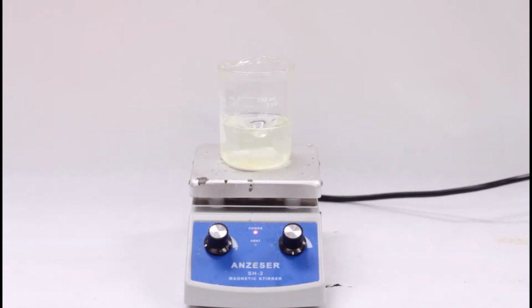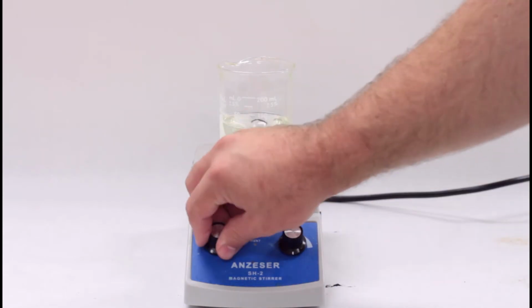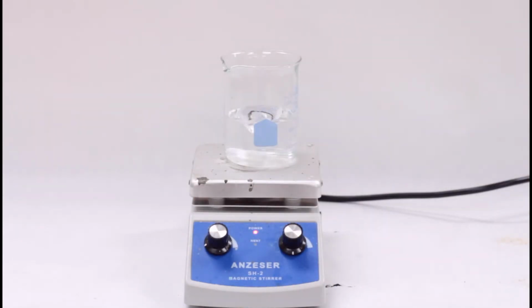The main method you'll use to differentiate between a solution and the other types of mixtures is the Tyndall effect. This is a light scattering effect that certain mixtures have and is very similar to Rayleigh scattering, which is why the sky is blue. Your definitions should be in the theory section of your lab report.